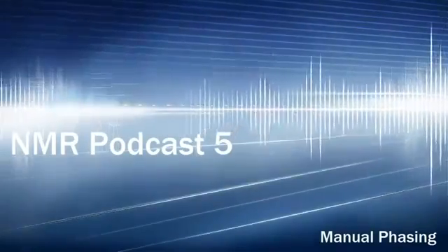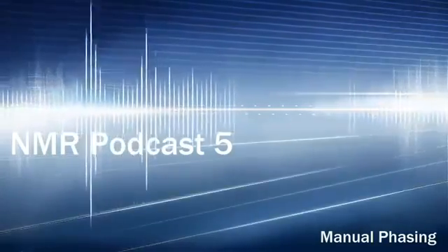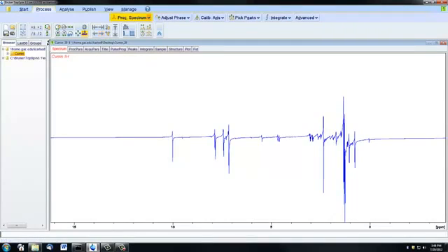This video is going to show you how to manually adjust your phasing using TopSpin. If you watched the third video, the basic processing, you will recall that there is a way to automatically phase a spectrum by clicking Process and then this Process Spectrum icon here. But it's important to know that there are certain times when the automatic phasing is not going to give you a very straight baseline, and in order to get proper phasing, you're going to need to do it manually.